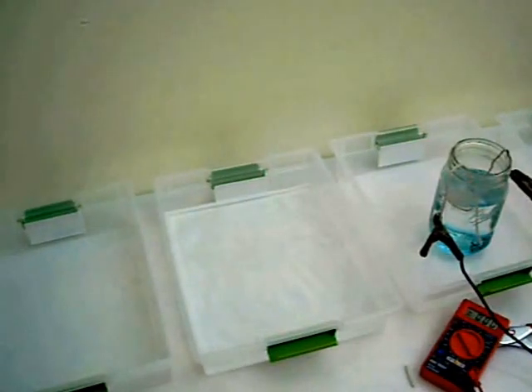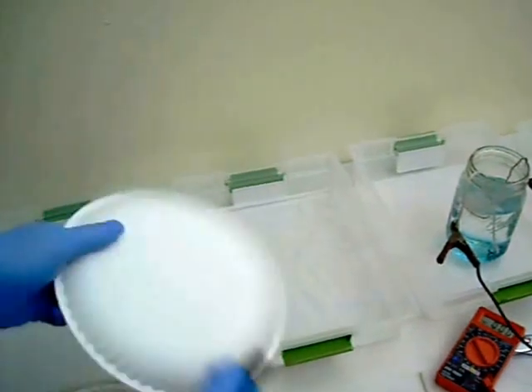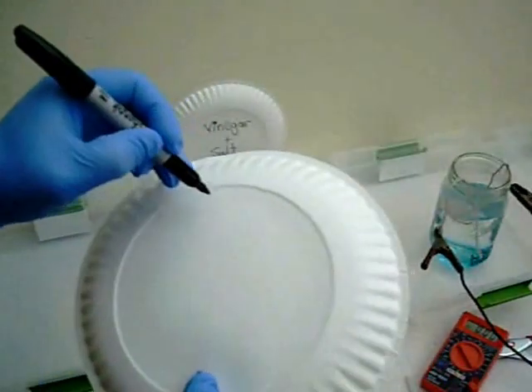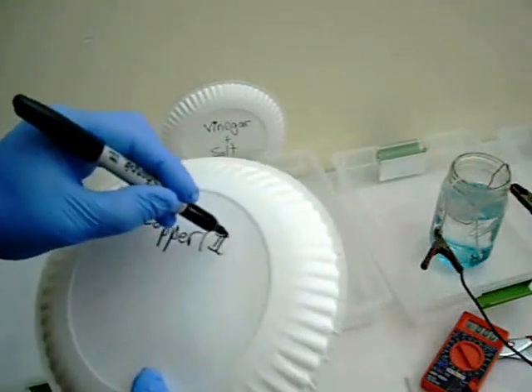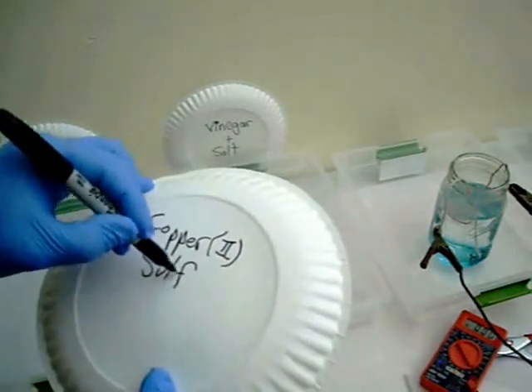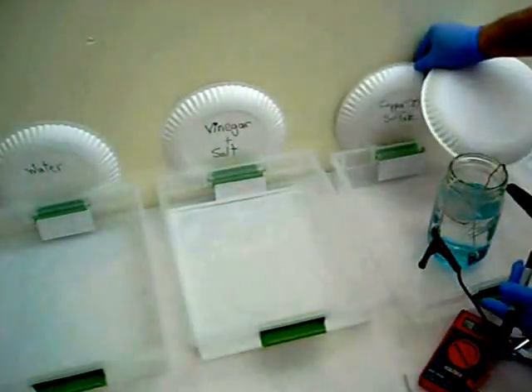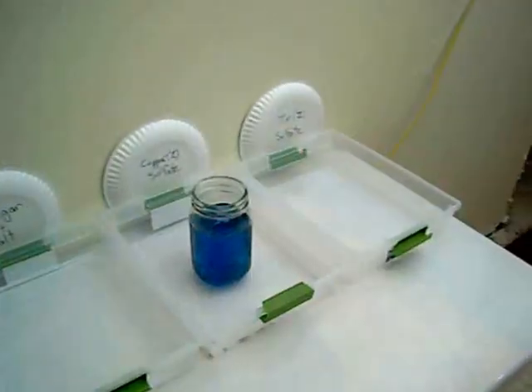Now I let this setup sit there for a few minutes while I make some labels. I'll eventually transfer this setup to a fume hood because the gas that's being evolved is hydrogen. While not necessarily toxic or dangerous, it is dangerous only because it's highly flammable.